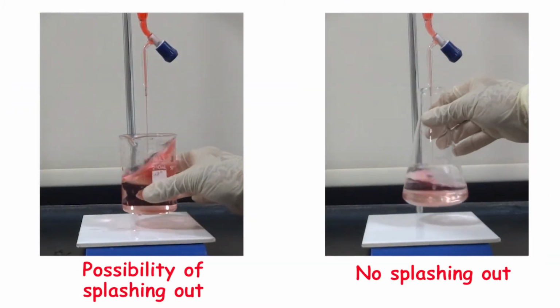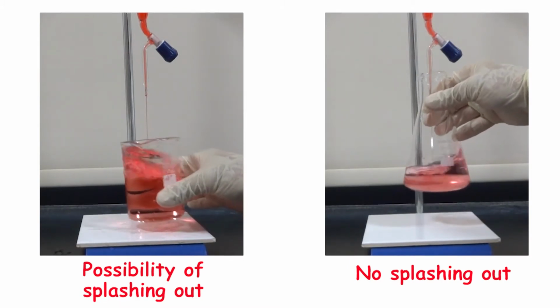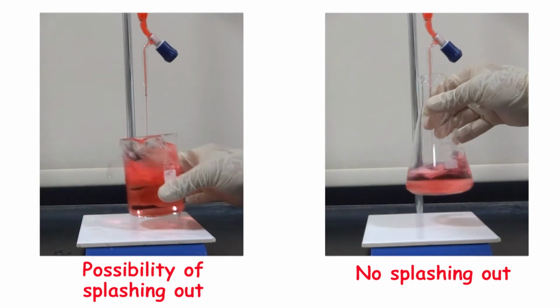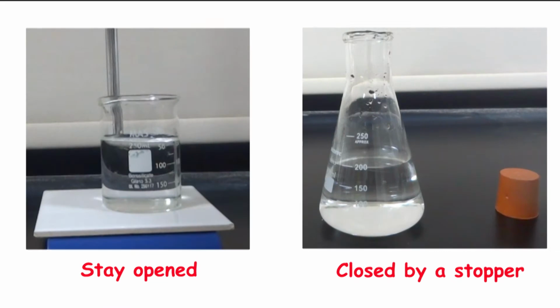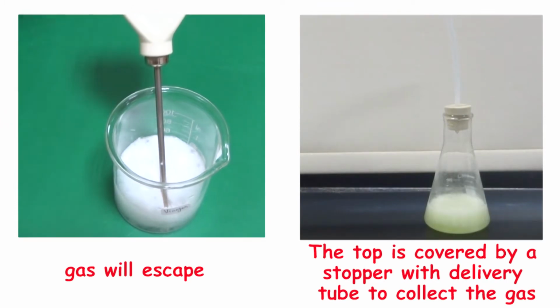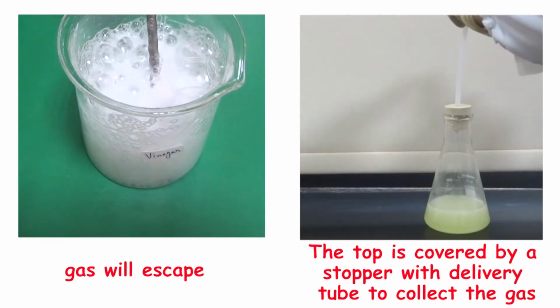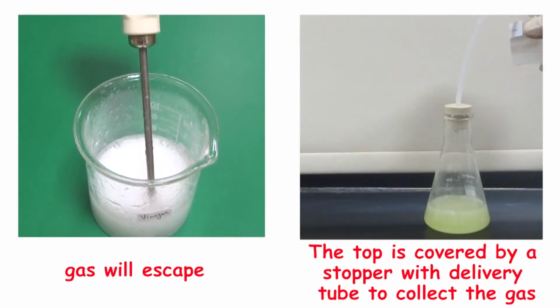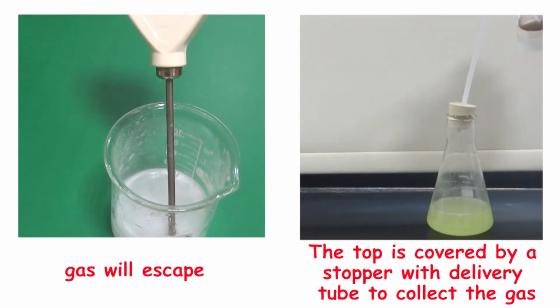When we're mixing in a beaker, there's a possibility of splashing out, while there's no splashing out when we're mixing in a conical flask. The beaker will stay open, while the conical flask can be closed by using a stopper. The gas from a chemical reaction will escape when it's done in a beaker, while in a conical flask, the top is closed by a stopper with a delivery tube, so the gas is recuperated.